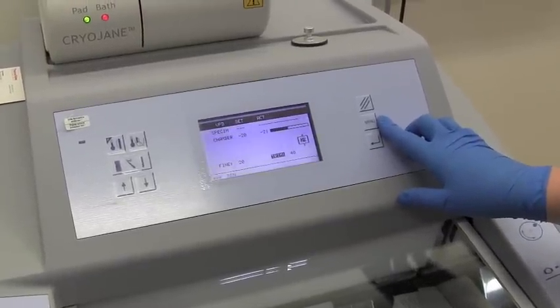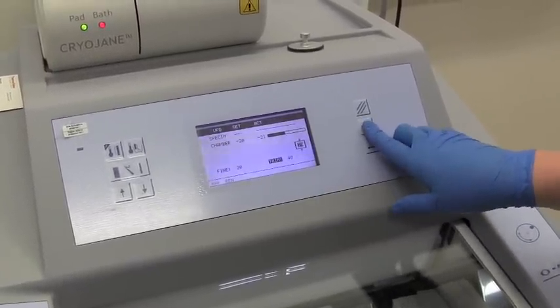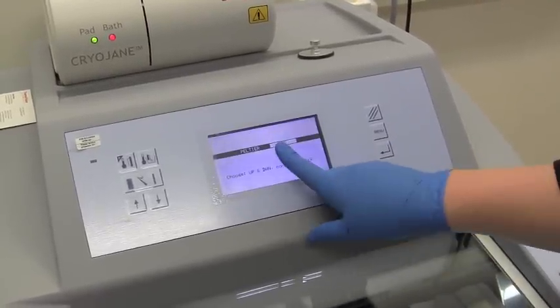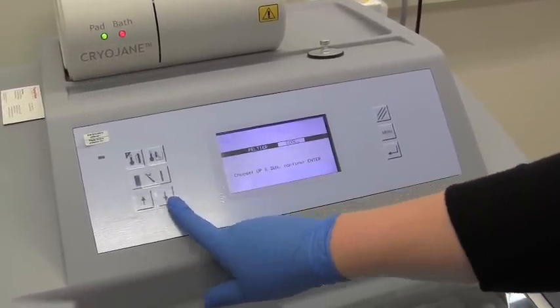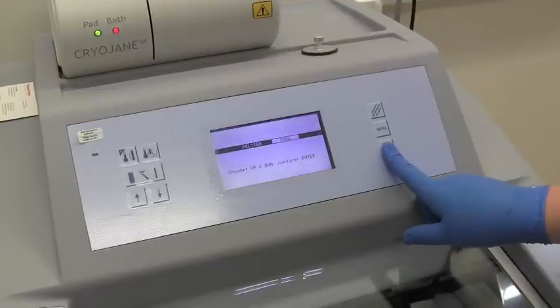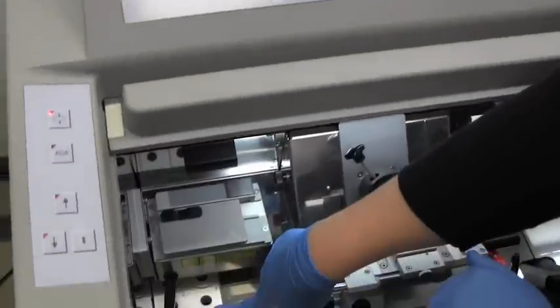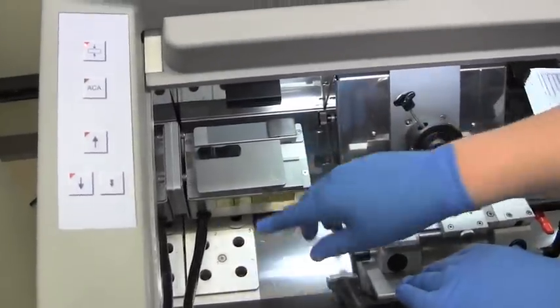So to get the samples frozen, we go to the menu selection at the Peltier station, press enter, and right now it's off. We want to move it down so that it's on the cool setting, and then press enter. What that does is make this block reach ultra-freezing temperature really fast.